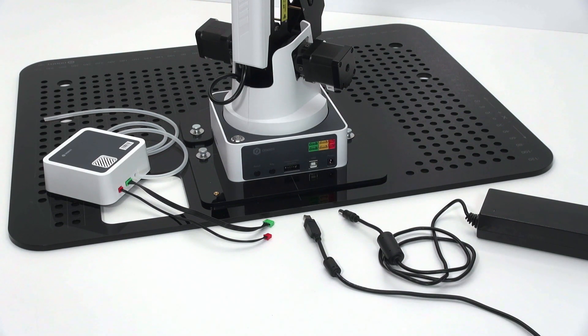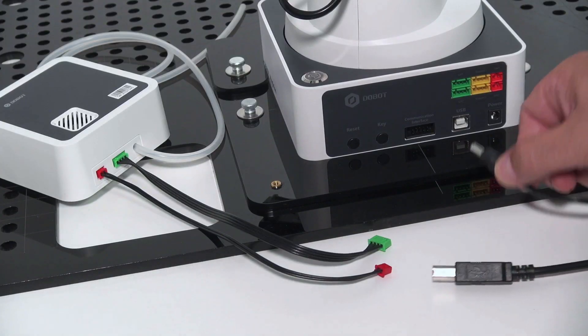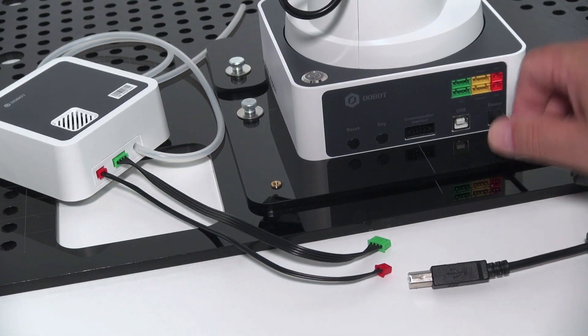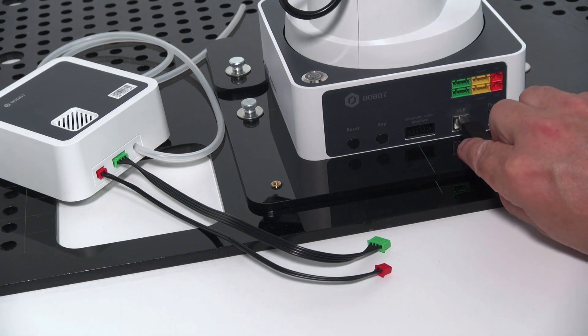The robot arm is fed by an adapter. It looks like a laptop adapter. The voltage is 12 volts. With a USB cable, you connect the robot arm with your laptop.